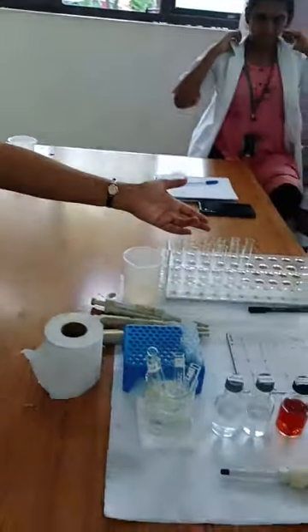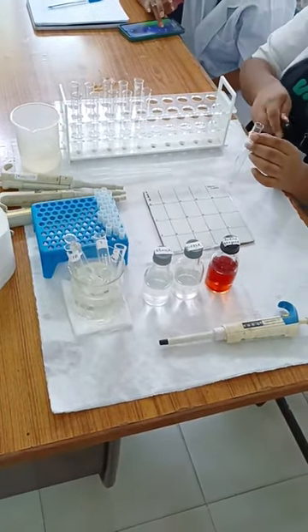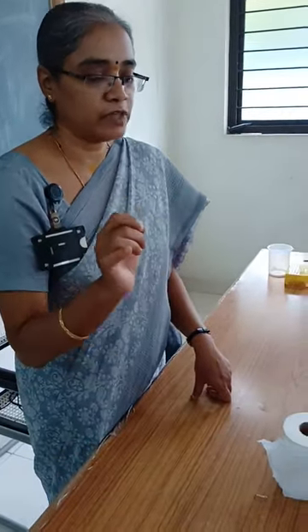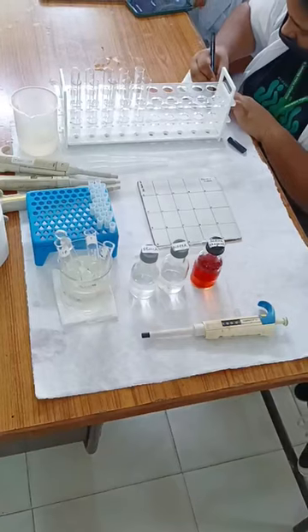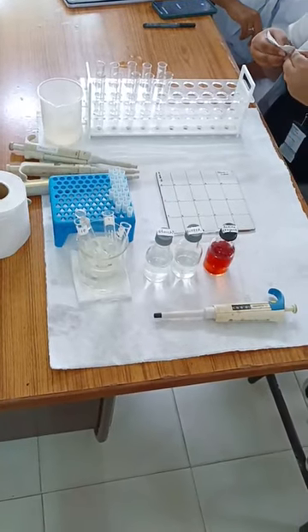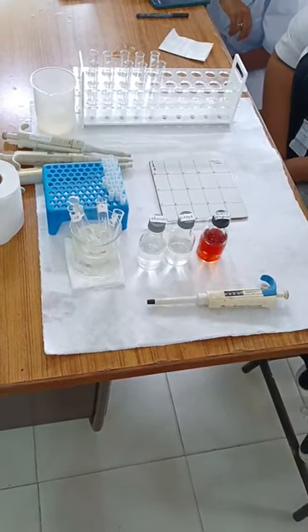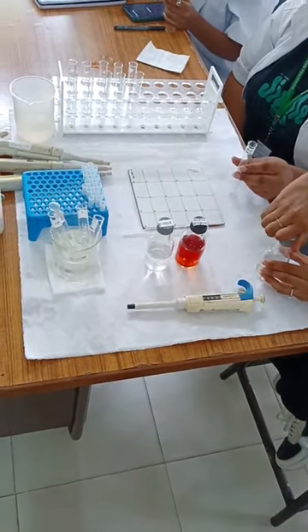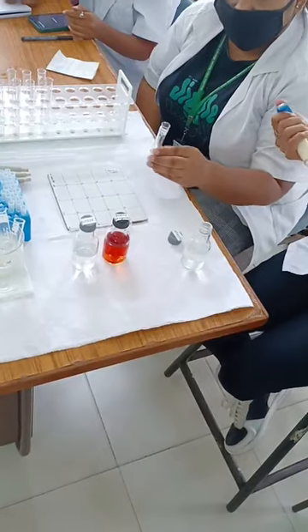Step 1: we are going to take the test tubes. One test tube is taken and labeled as the reaction mixture. The reaction mixture will contain 2 ml of the substrate (starch), 2 ml of phosphate buffer, and 0.4 ml of the diluted enzyme. The moment you add the enzyme, make sure the timer in minutes is running simultaneously, so that at every interval we take a drop of the reaction mixture and place it on the tile to find the end point.